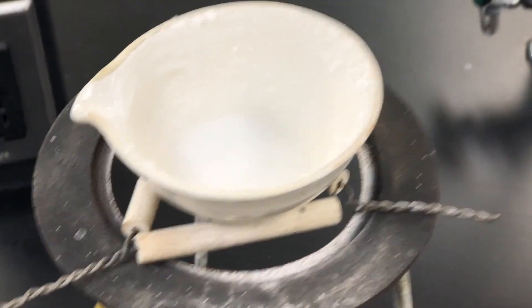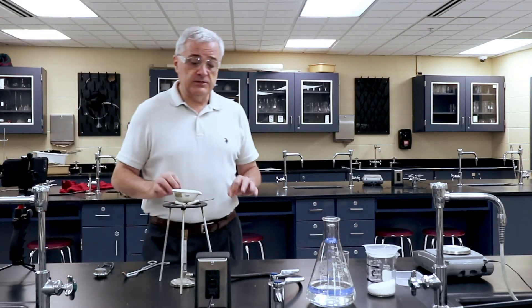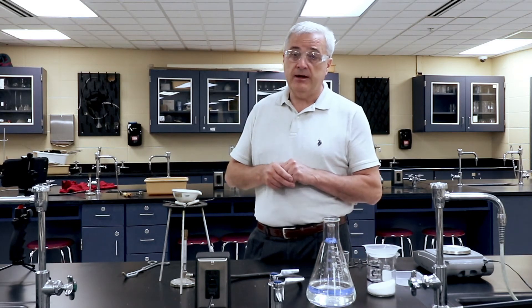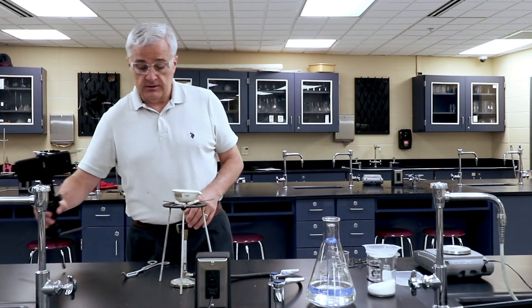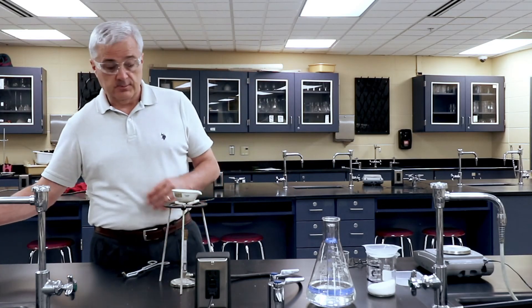You're seeing a lot more crusty stuff on the side of the evaporating dish. And what could that crusty stuff be? The dish is still hot so it's going to continue to boil. It spews and spatters — if you are observing very closely, you will notice that on the lab table there are places where it has spattered out. So you want to be careful not to have that spatter out on you.